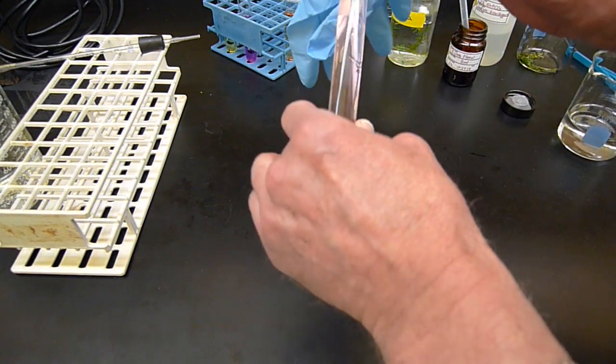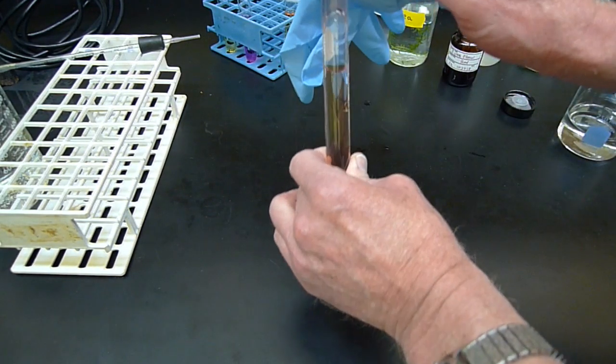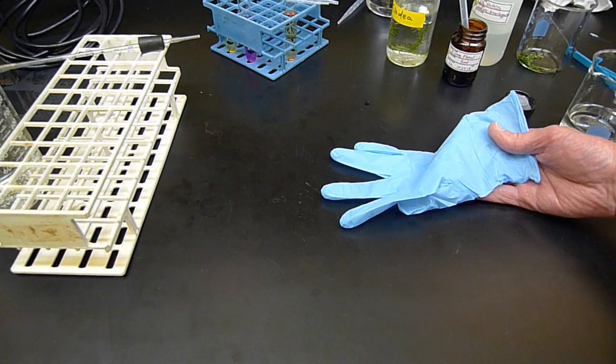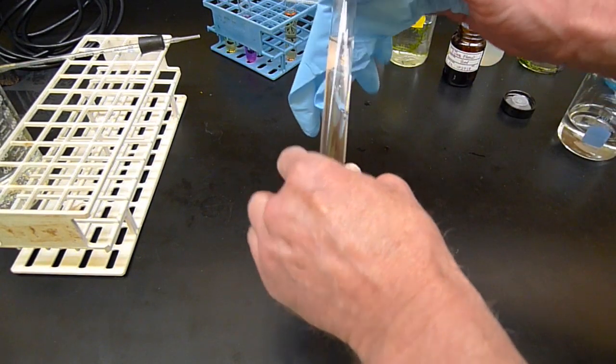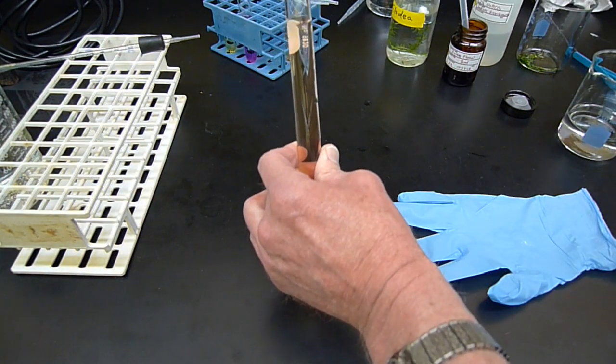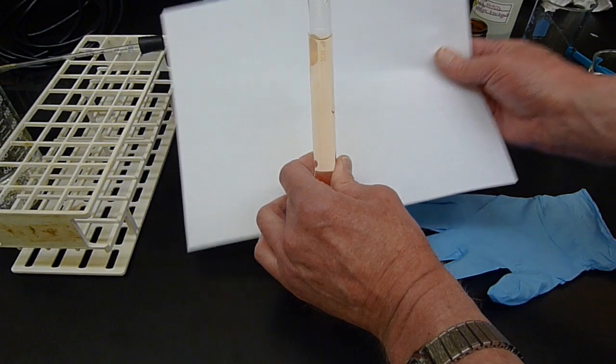But we are. CO2 really does have properties of an acid. It gets kind of complicated when you're dealing with it in water, but carbon dioxide itself is an acid. It's turning kind of orange now. Maybe that's good. I'll take that.